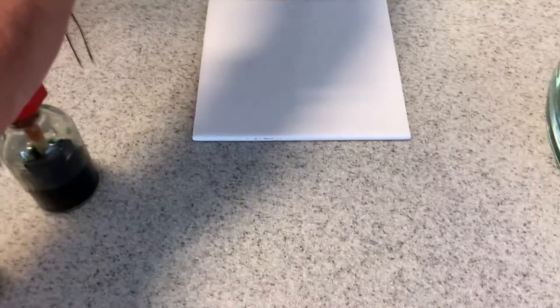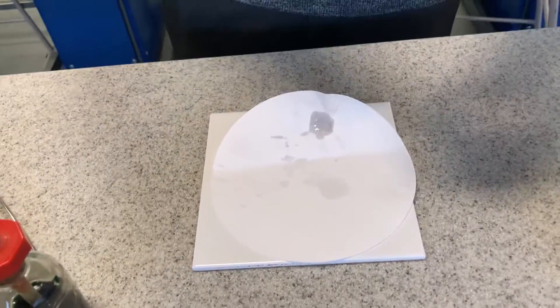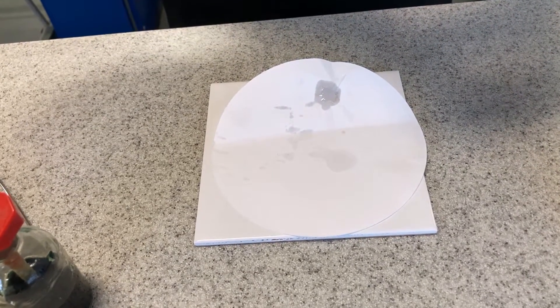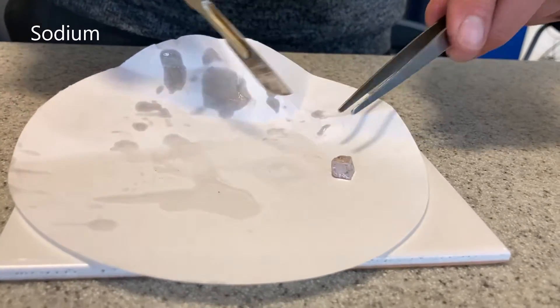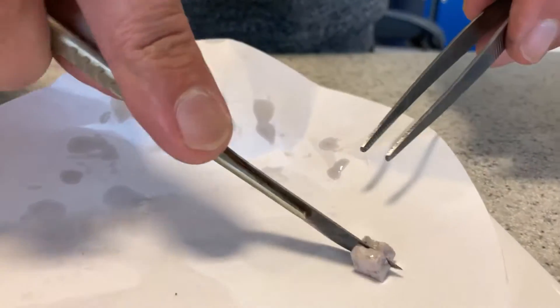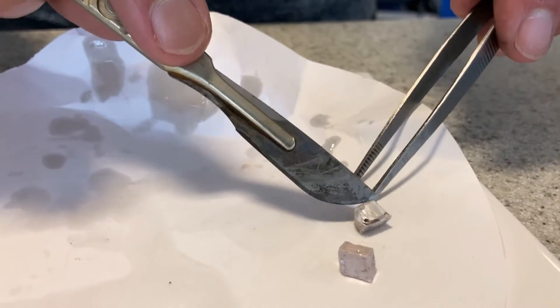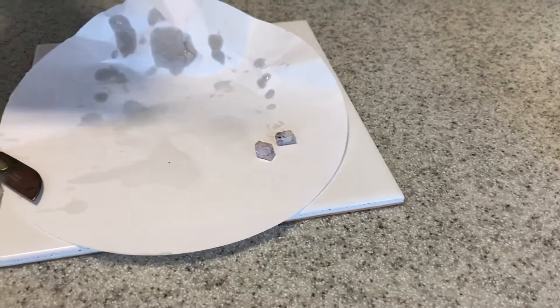Looking at sodium. This is sodium. It's a white-looking metal, but actually that's sodium oxide — it has reacted a bit. But if I cut into it, that's very easy to cut. Can you see how shiny that is on the inside? It looks like a metal, but it won't last long. Now let's put it in the water. It's already starting to go purple from the lithium. And off it goes — it's bubbling away.